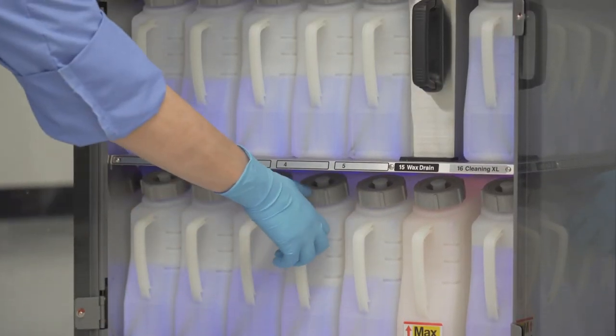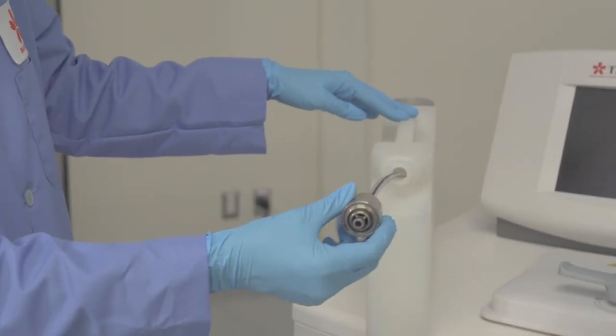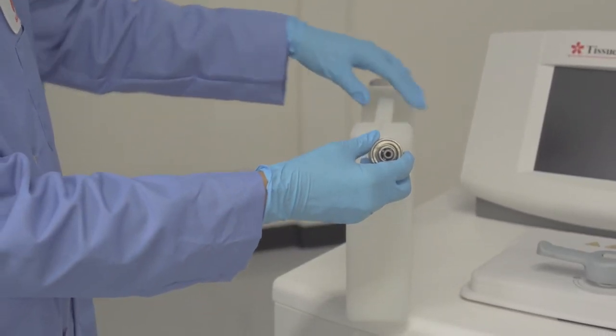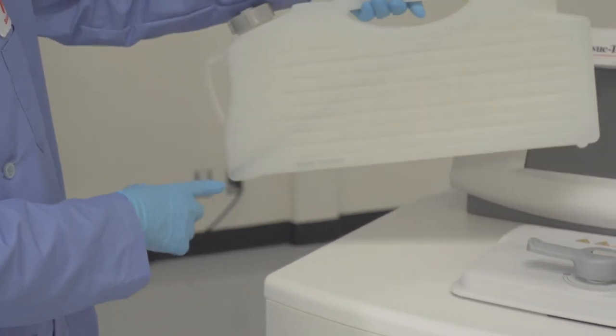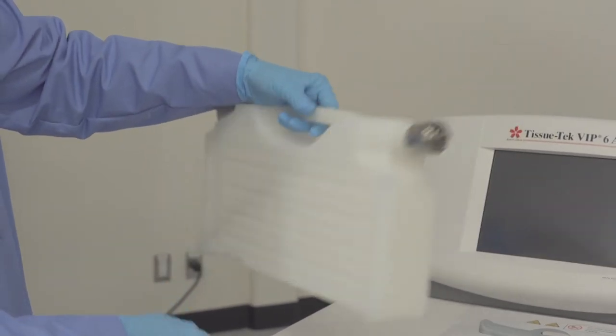With the nozzle still off the bottle, you will see the Teflon tubing. To properly draw the reagent from the container, the end of the tube must be pointed down. Improper placement of the tubing will cause load fluid errors.